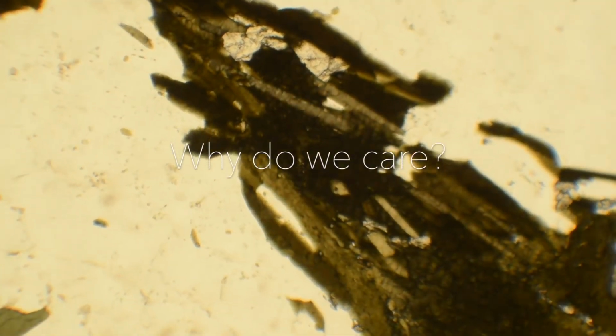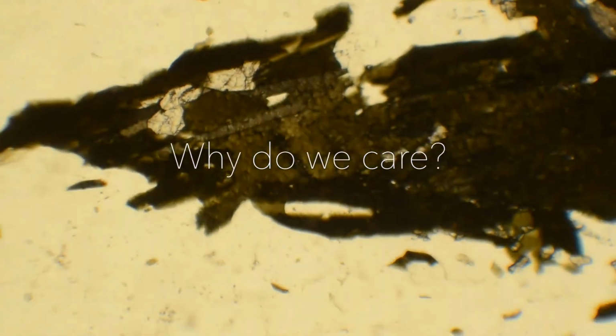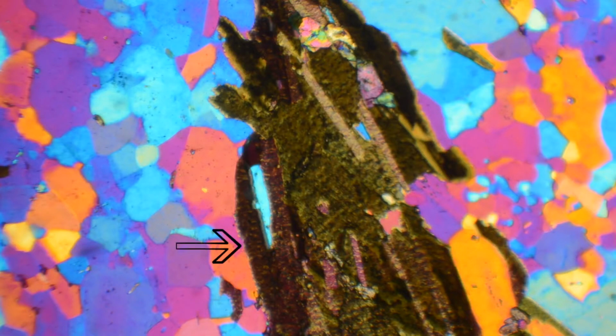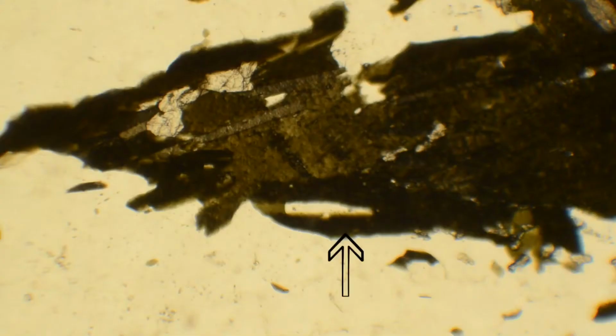So why do we care? Some types of mineral grains display different color or relief along their fast or slow rays. In this snapshot of this pleochroic mineral, where the accessory plate is inserted, take note of the interference color where the arrow is pointing. Also take note of the interference color 90 degrees away. As I switch back to plain polarized light, notice the color of the mineral in this orientation versus this orientation.